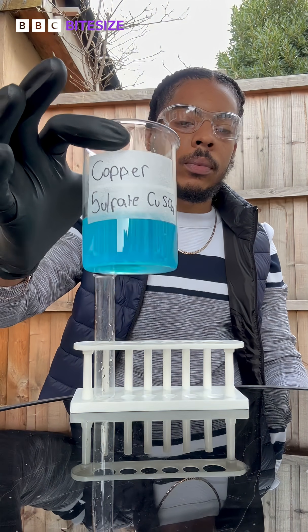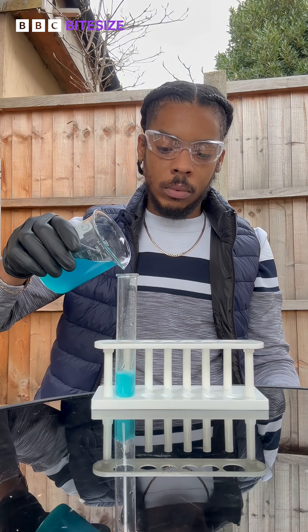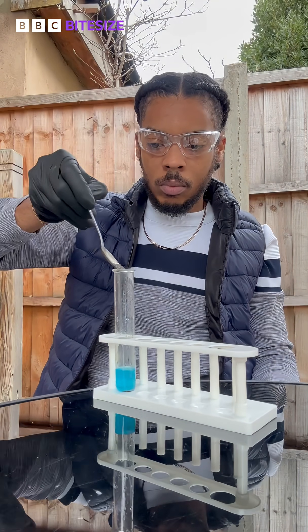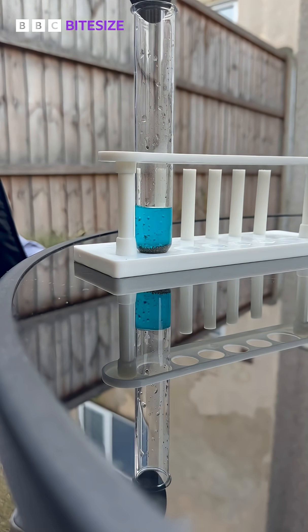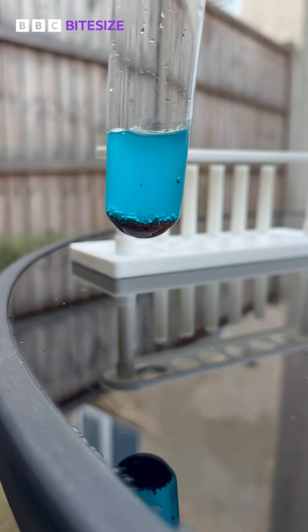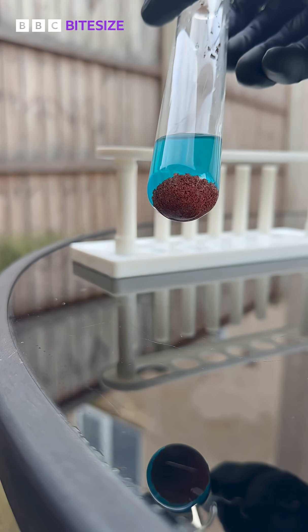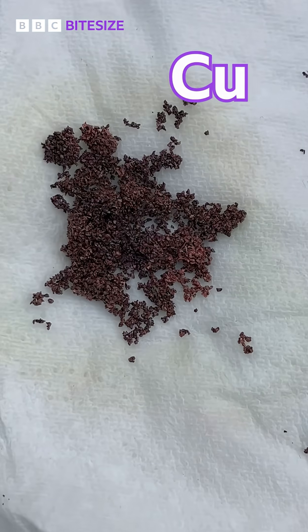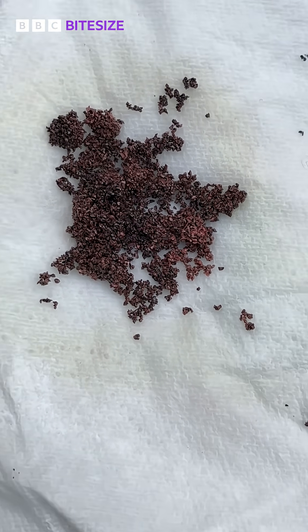We're going to react the metal salt solutions with the metals, starting with copper sulfate and iron. When we add iron to copper sulfate, we can see a lot of bubbles being formed, and that's because iron is more reactive than copper — it's able to displace the copper in copper sulfate and form iron sulfate. We can see copper forms a precipitate on the iron.